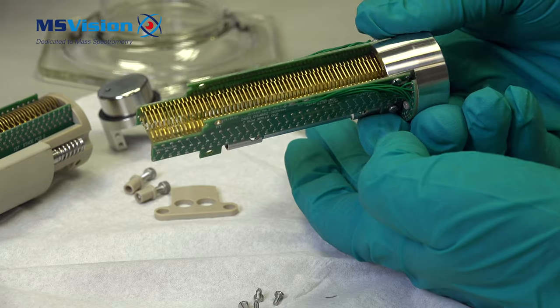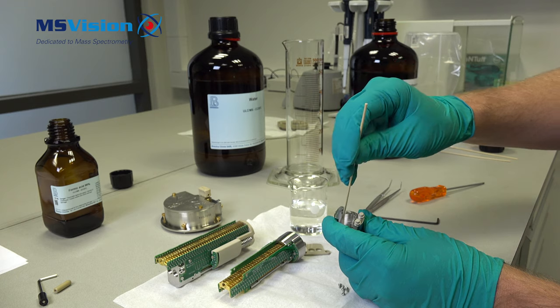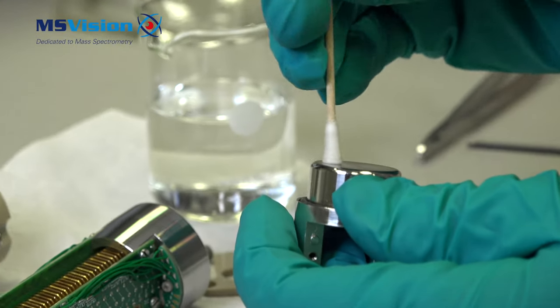This as a whole can go into an ultrasonic bath suspended in a cylinder of methanol. I'm going to remove most of the black marks with a cotton swab and some methanol.